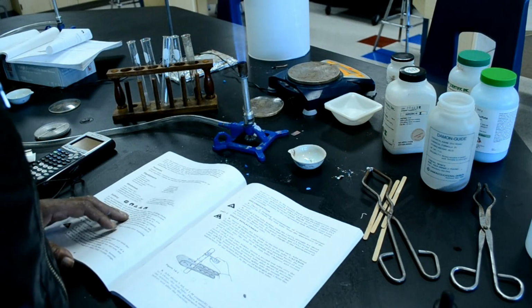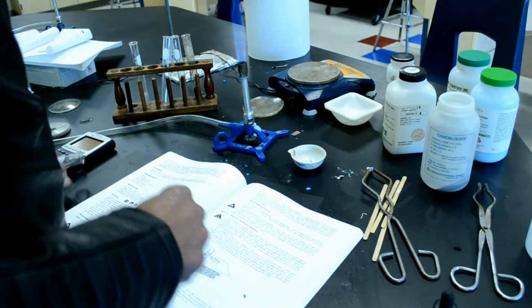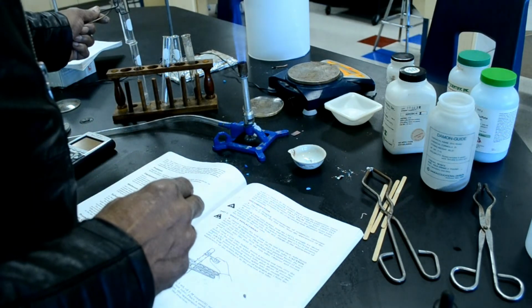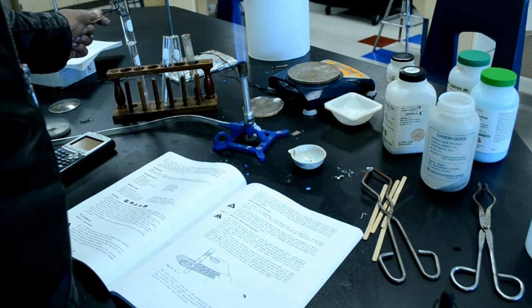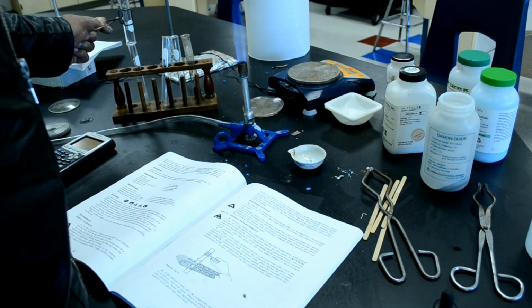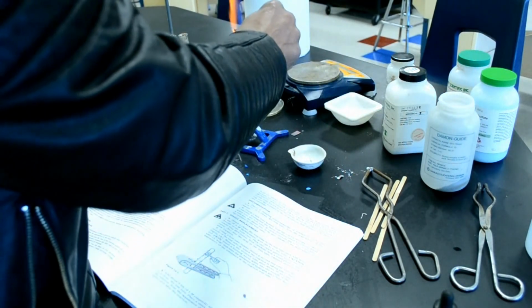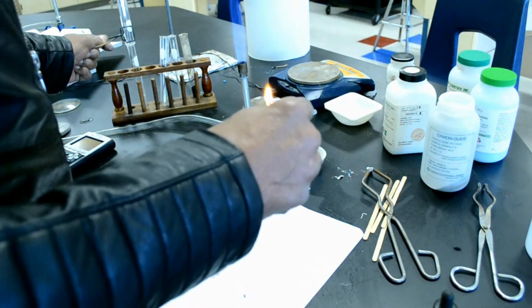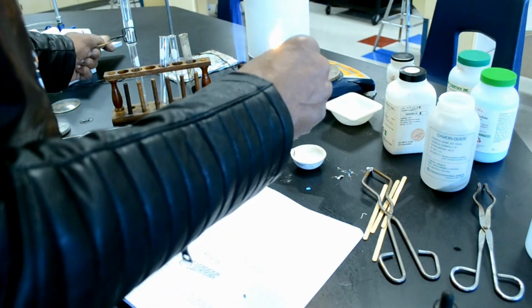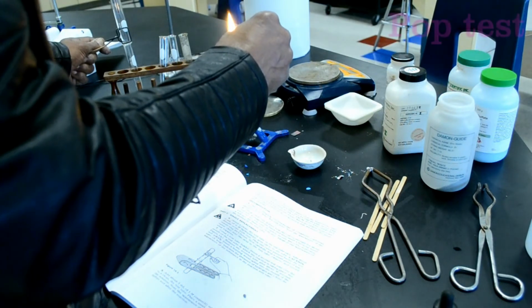Then it says, using a test tube holder, invert a second test tube over the mouth of the test tube in which the reaction is taking place. So I'm going to invert a second test tube over that. Then it says, see figure 14-1, remove the inverted test tube after about 30 seconds and quickly insert a burning wood splint into the mouth of the test tube. A pop indicates the presence of hydrogen gas. So we kind of knew hydrogen gas was being formed anyway, but let's see.